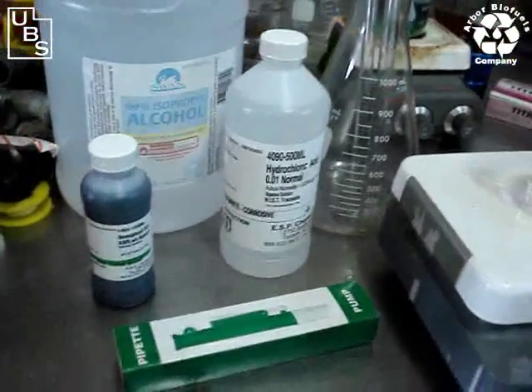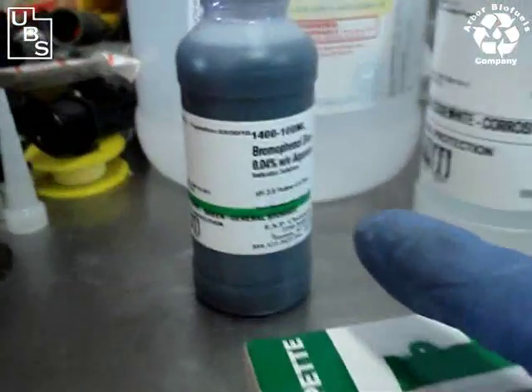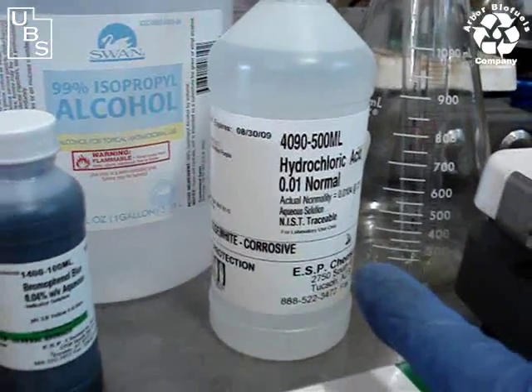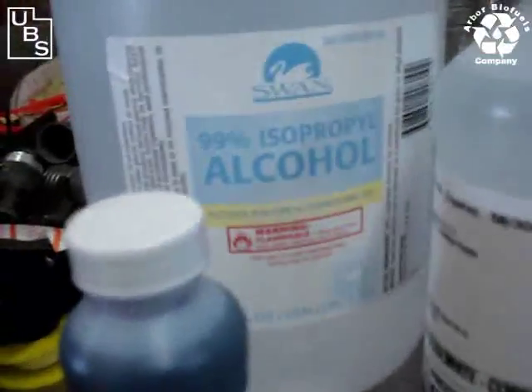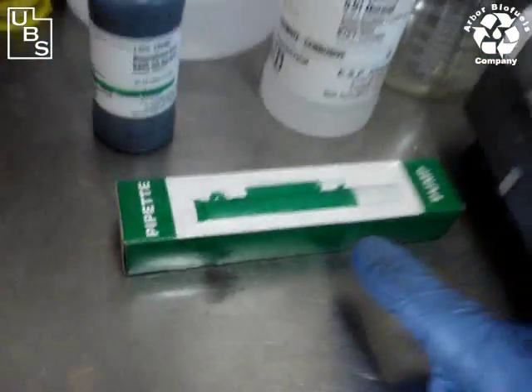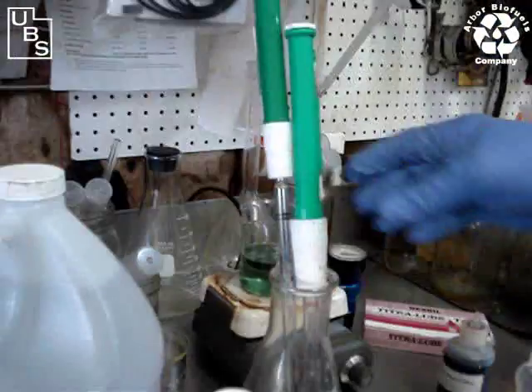Now we're in the Arbor Biofuels lab, and I'm going to show you what we're going to use for this next soap test. We have a bottle of bromophenol blue, a bottle of hydrochloric acid at 0.01 normality, alcohol with 99% pure isopropyl alcohol, and then we have the pump that we're going to use for the dispenser, and they're right here already hooked up.